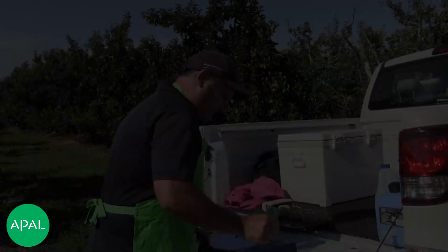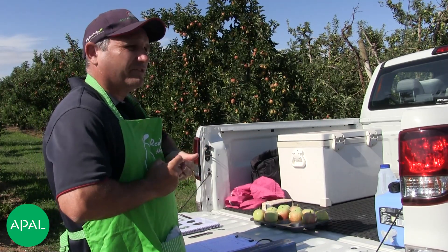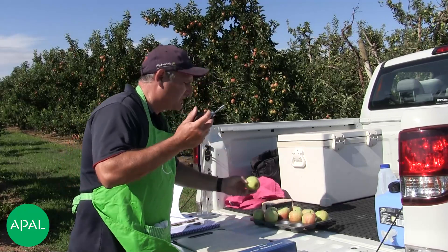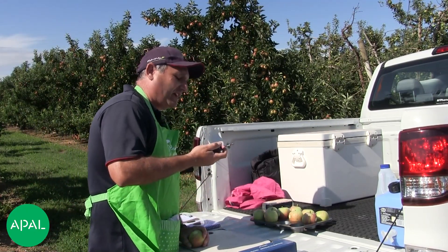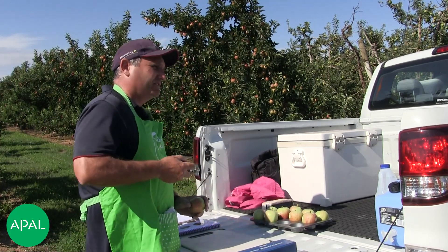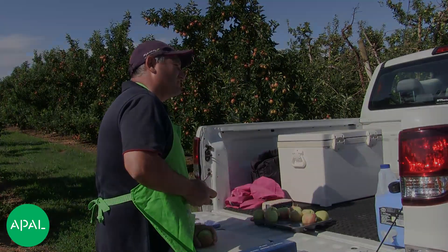It's very important to have a good peeler. With the penetrometer, it's very important that you make sure it's fairly loose and free, not sticking, because that can impact on the reading you get in kilograms of pressure. It's also very important when you test pressure that you're quite rigid in how you apply pressure on the gauge. Sometimes I see people doing it too loosely, which gives the wrong reading. So it's important that you're consistent in how you do it, with your movement consistent each time.